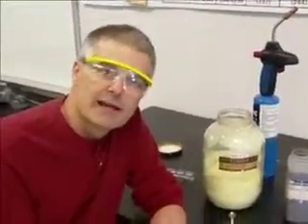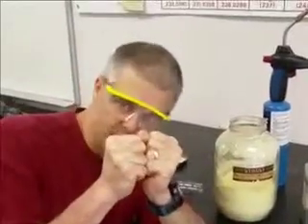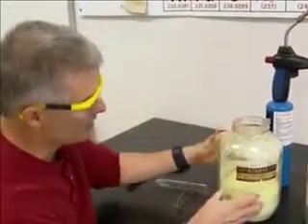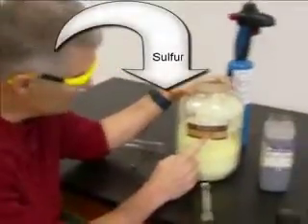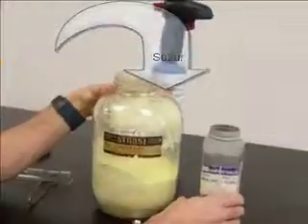All right, now I want to talk about a combination reaction. A reaction where you have two things, and they're going to join to make one. The reaction I'm going to work with is I have sulfur, elemental sulfur, right here, S. I think it's S8, isn't it, Mr. Sanders? It is. And I have iron metal.